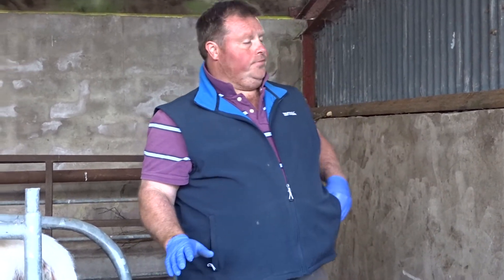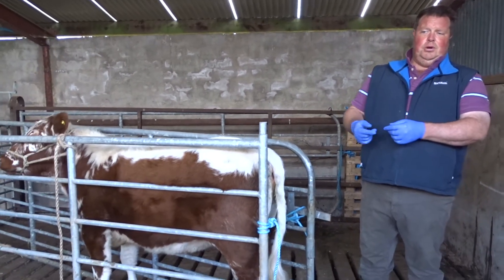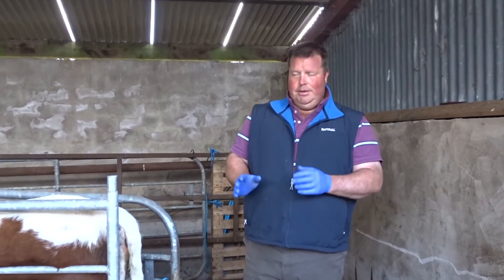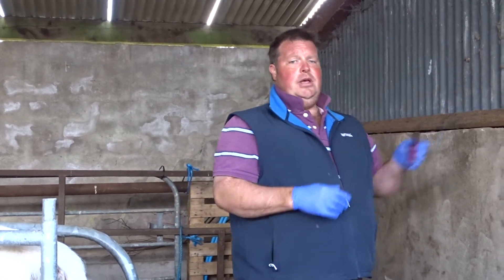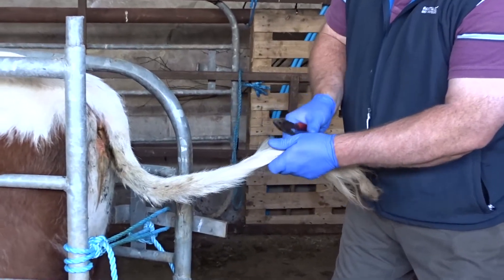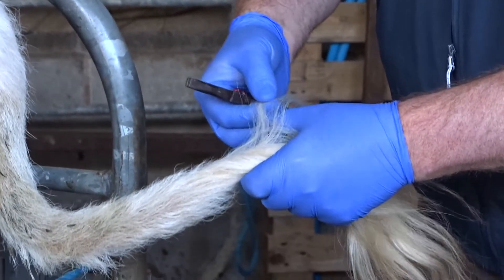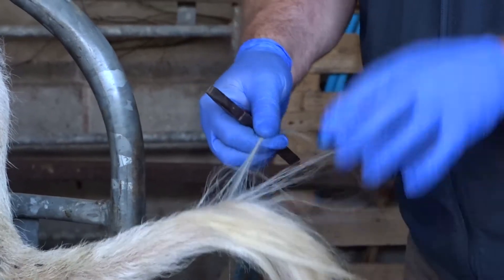Now this is an eight-month-old heifer, relatively easy to pull out. I find younger calves are a wee bit harder to pull out. You might like to use a tool, especially if you have a little bit of arthritis in your fingers. A simple pair of pliers should do adequately. So I'll show you just quickly here — basically again, pick the right amount of hair, not too many, not too little.